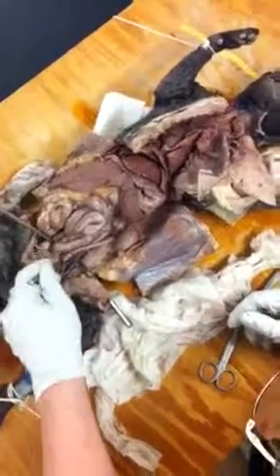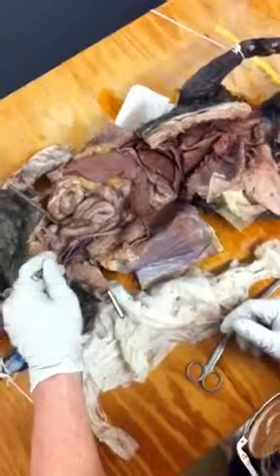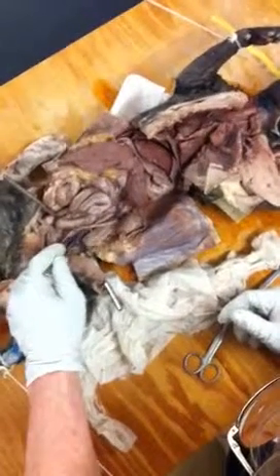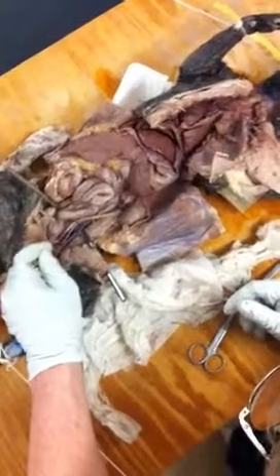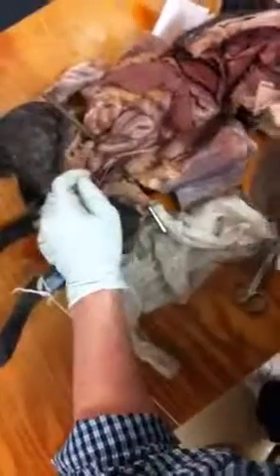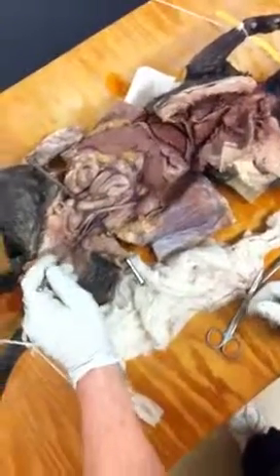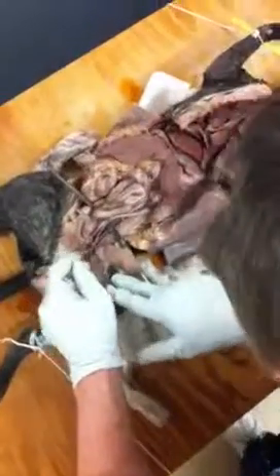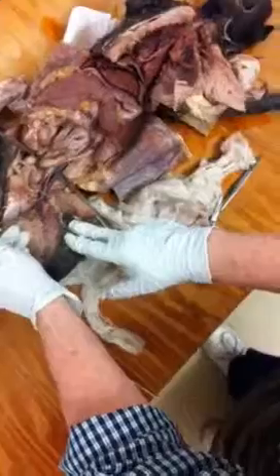I'm trying to keep all the arteries out of the way. So this is the external iliac artery. This is a common iliac vein. Here's a common iliac vein here. They continue and parallel, and now it's external iliac vein. Same thing, okay? And then there's an internal that branches off here, but you can't see it. So that's not available. And it looks like it narrows. It does, and it comes right into the femoral vein.